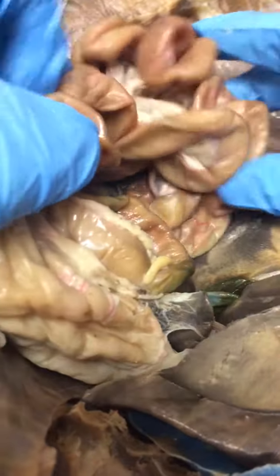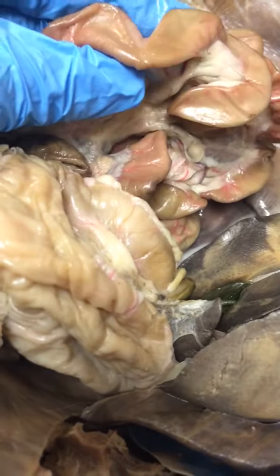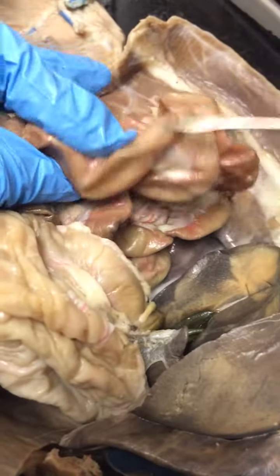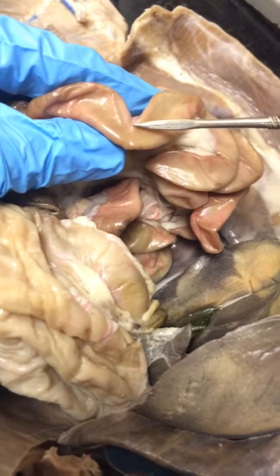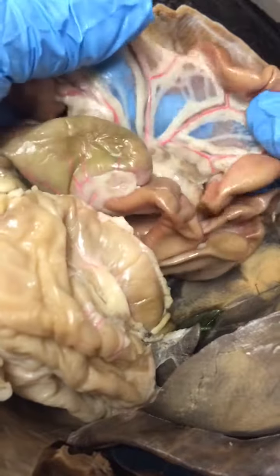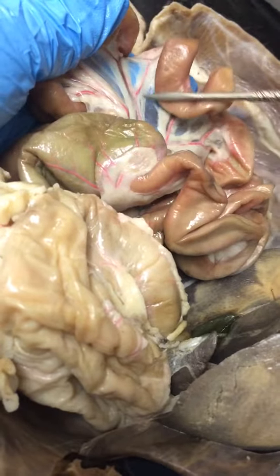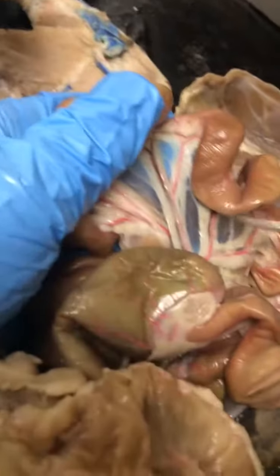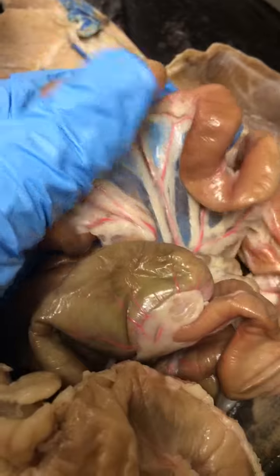Moving onward in the middle, so just all the intermediate small intestine area, anywhere that's basically not connecting to the stomach or later to the large intestine, that's your jejunum. Okay, the jejunum. Right here, this is actually a really good view of it. You can see the mesentery. Okay, that's all of this, this really vascular connective tissue, the mesentery.